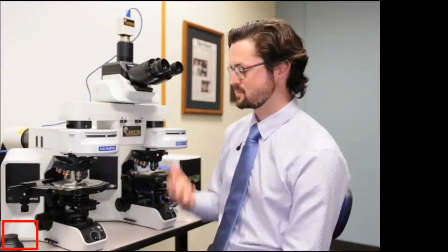And in today's live stream, we're going to be going over the trace comparison microscope you see behind me. And we're going to be talking a little bit about color balance. We're also going to be going over Kohler as well. Two very important things for trace examiners.